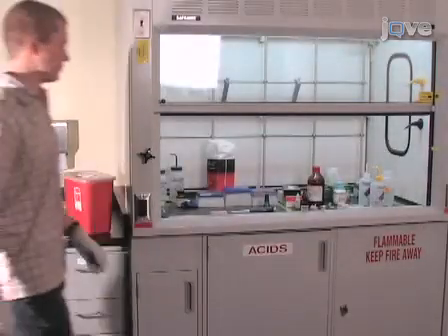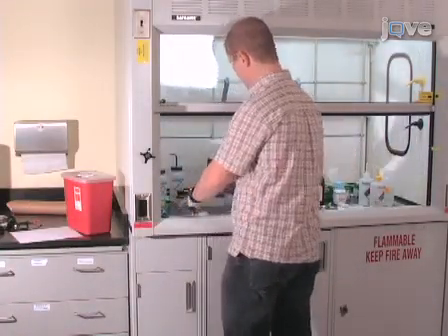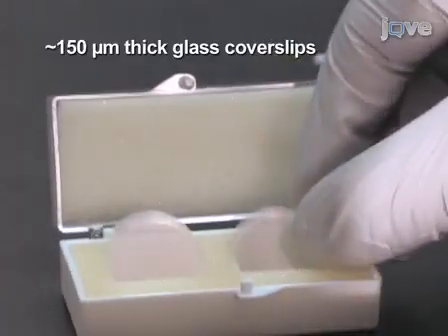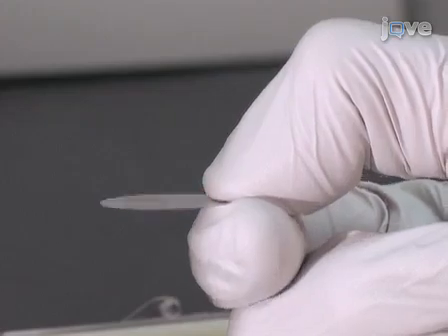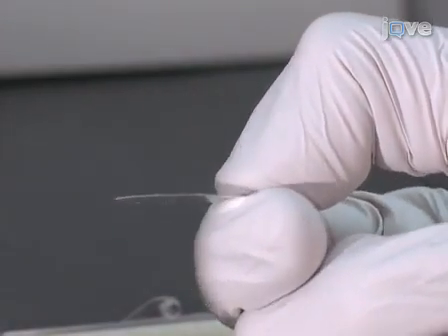In order to obtain clear, reproducible images, some care must be taken in preparing the samples. Samples are typically prepared on approximately 150 micron thick glass cover slips. These cover slips are thin enough to allow for high-resolution imaging with the high NA water or oil immersion objective lenses that are used in these experiments.